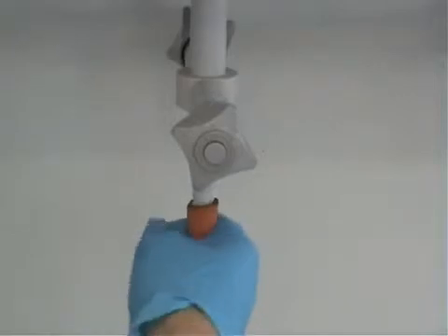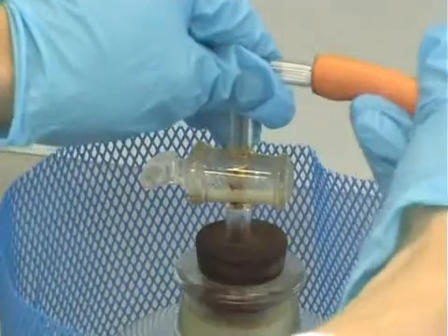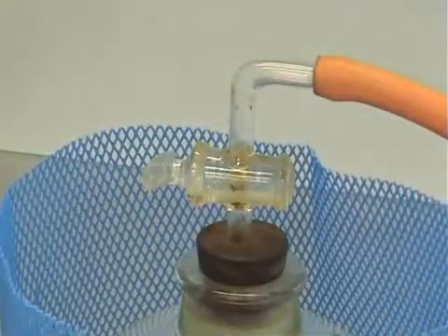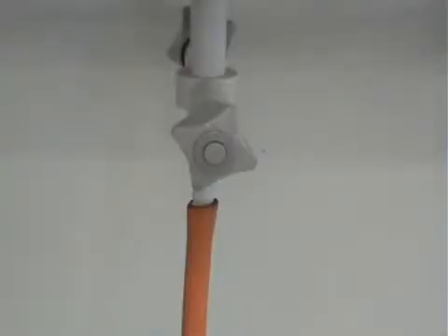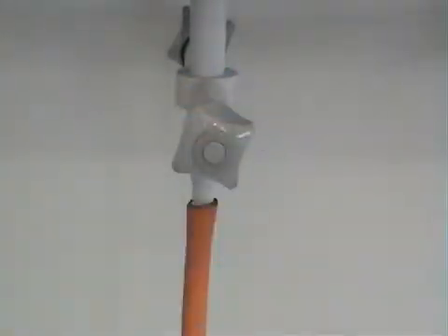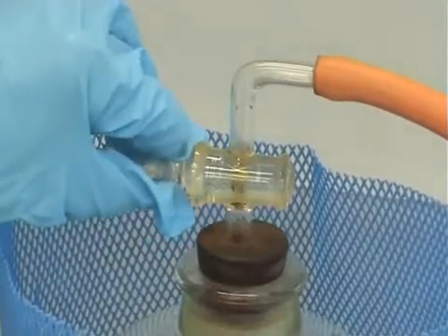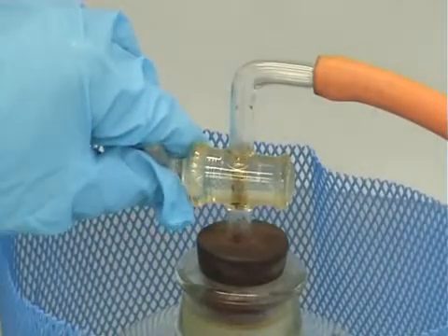Attach vacuum tubing to the vacuum line and also to the valve at the top of the desiccator. Then turn on the house line vacuum and slowly open the desiccator tap. You should hear a hissing of the air escaping.